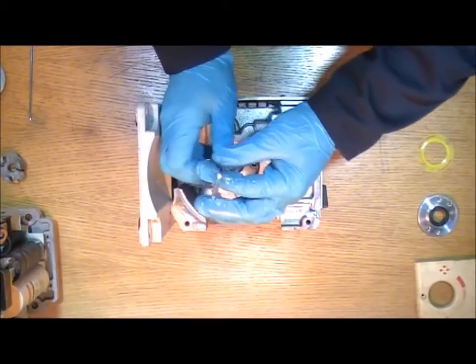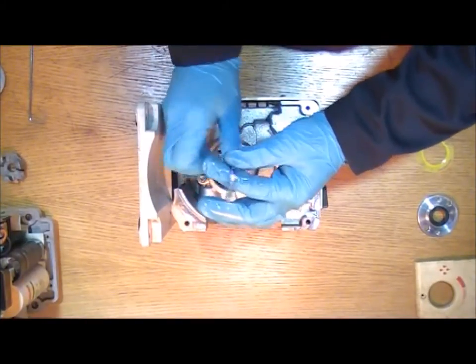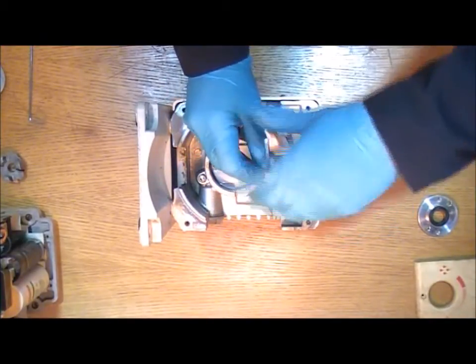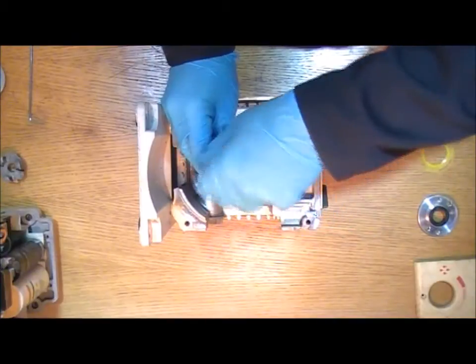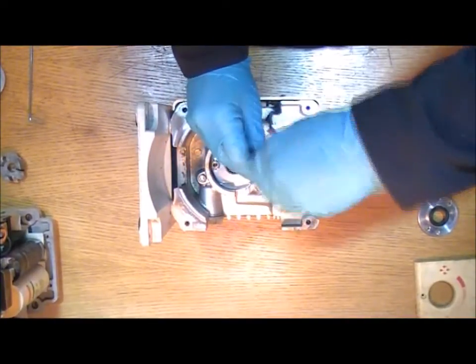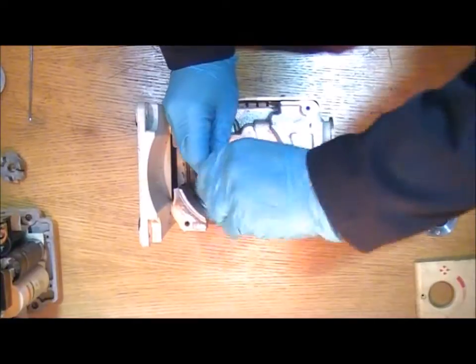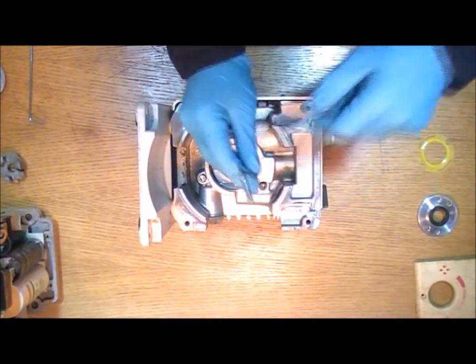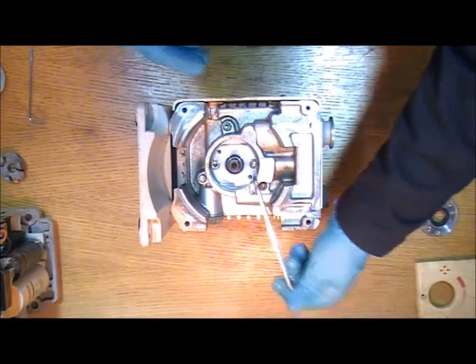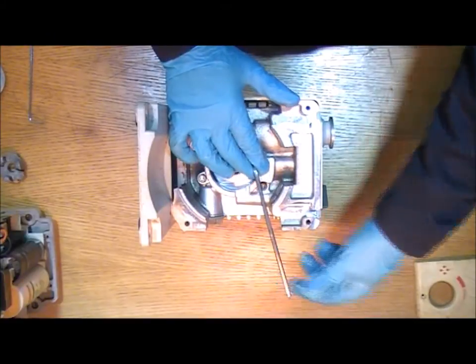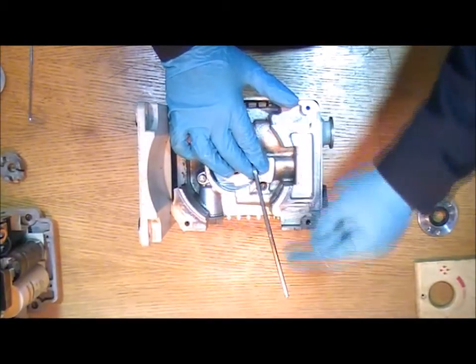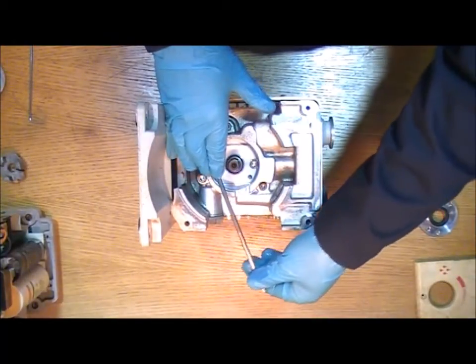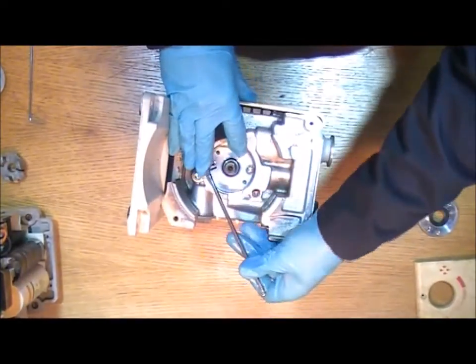Tighten them down. And as you do so try to get an even force on the two bolts. So a couple of turns on each side until they're snug. And then to be sure it's all tight you can turn your allen key around going from the side. And this is where you get access with the panel removed. Just to give them a last tightening off.